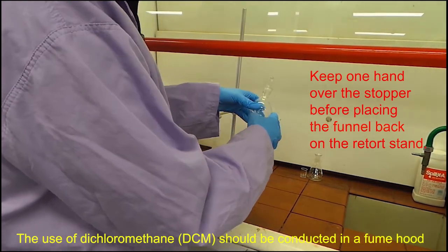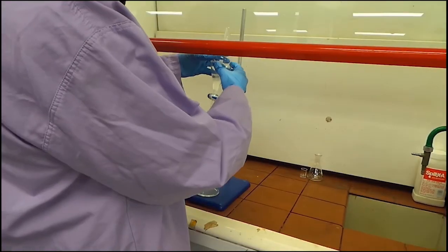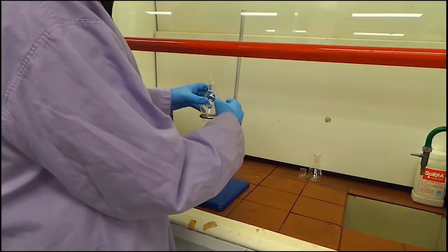Now return it to the ring and remove the lid. Wait until you can clearly see the separation between the layers.